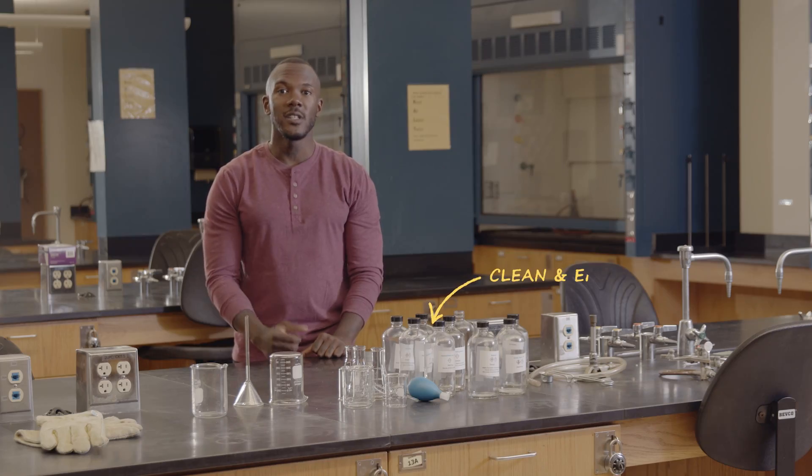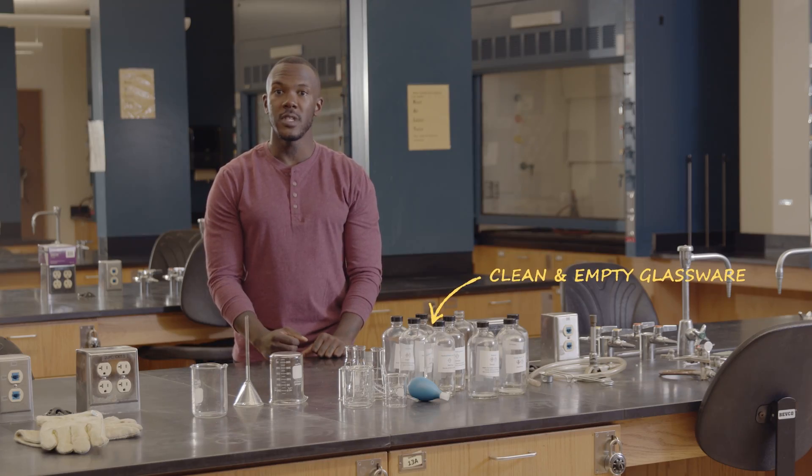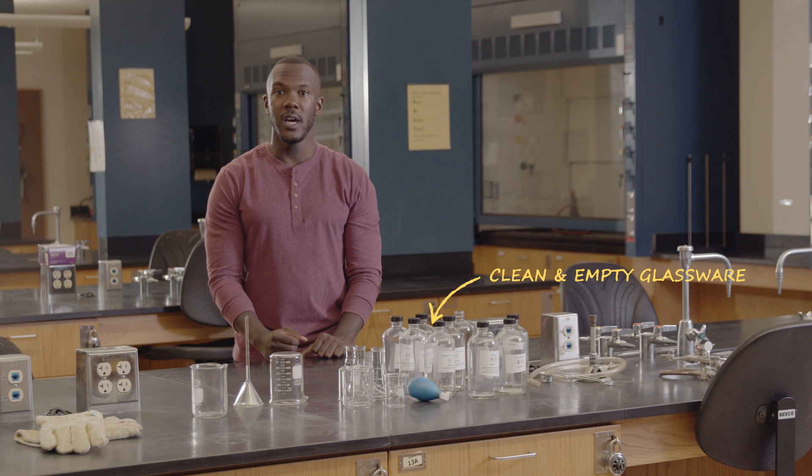Hi, welcome to Chemistry Lab. If you're a college student, you may have already taken a high school chemistry course and learned some rules of lab safety along the way. As you begin college classes, you'll probably hear some of the same rules you learned in high school. In this video series, our goal is to build on those rules, but go a bit further. We'll establish basic principles of lab safety that you can use in any new situation.